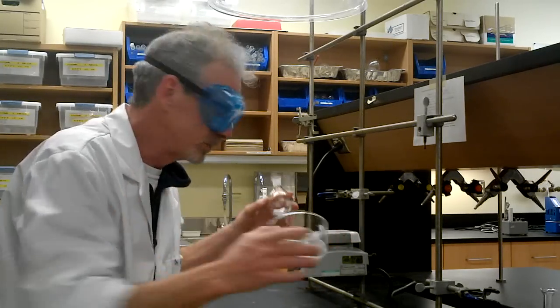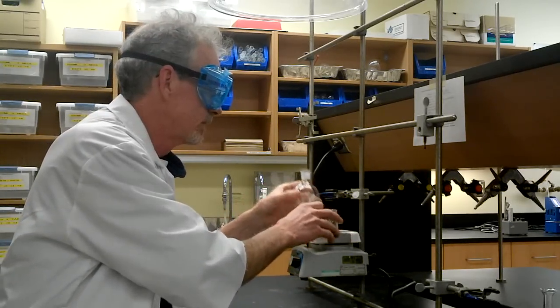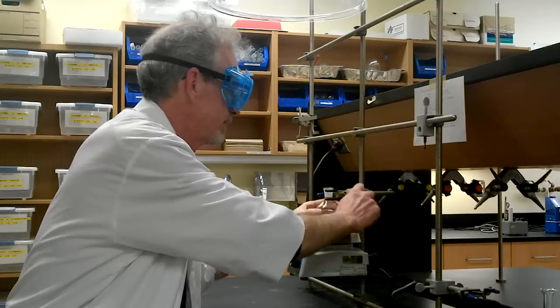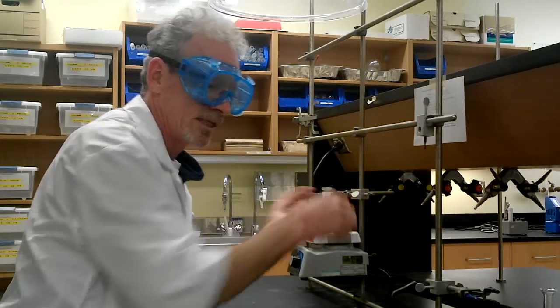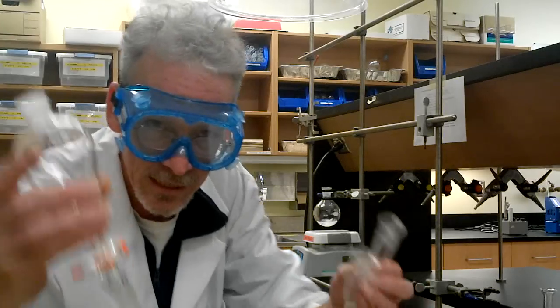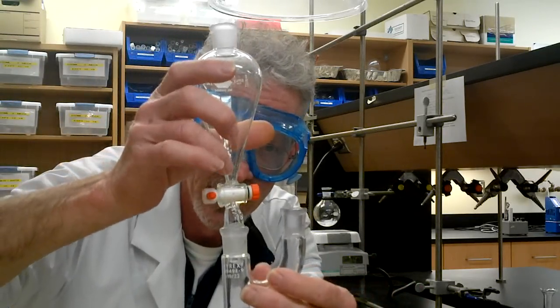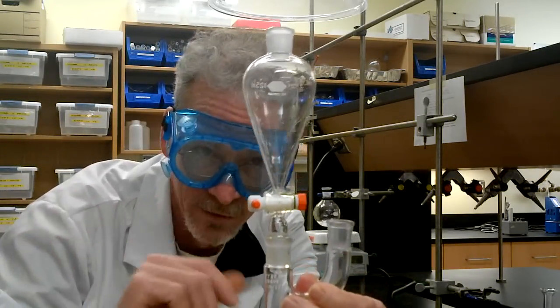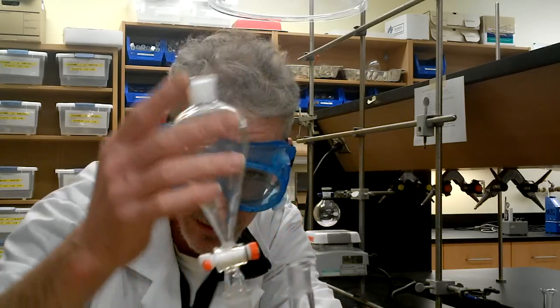We have a little cooling bath, which has nothing in it, which I better deal with. So our flask is clamped into place, and we're going to be adding the acid, but it'll vapor lock unless we have an opening for the vapors to get outside.